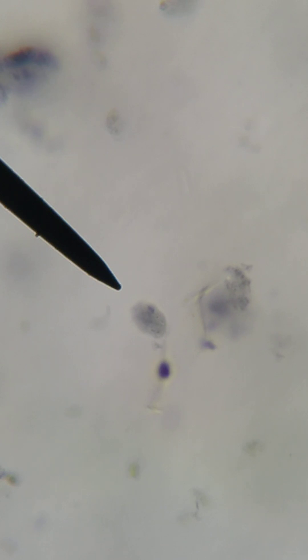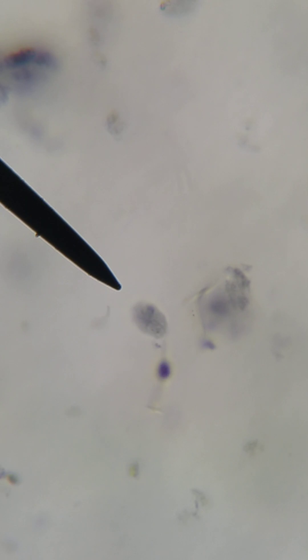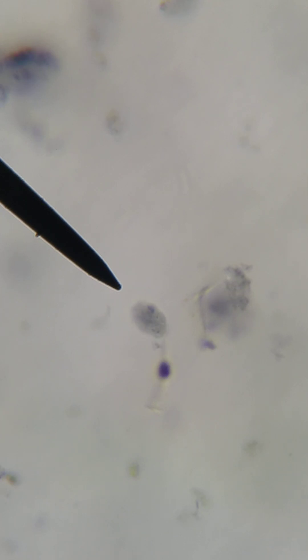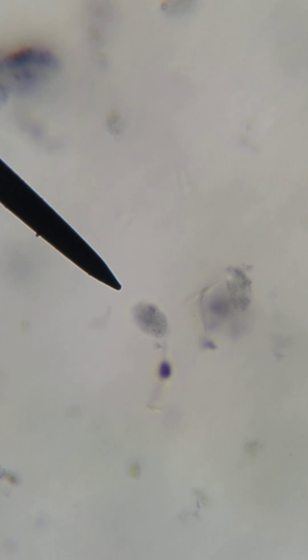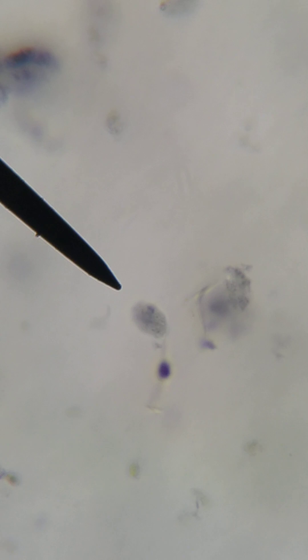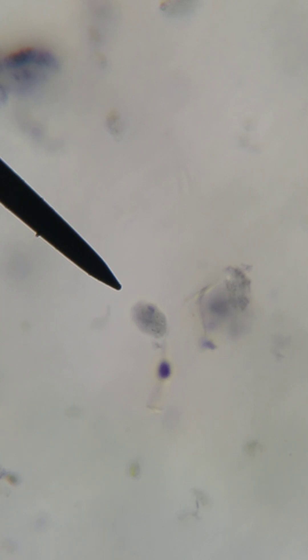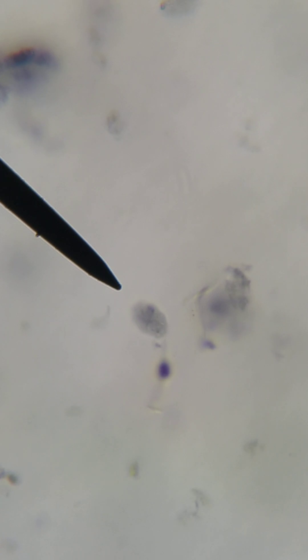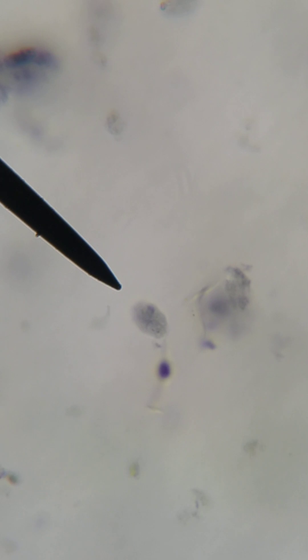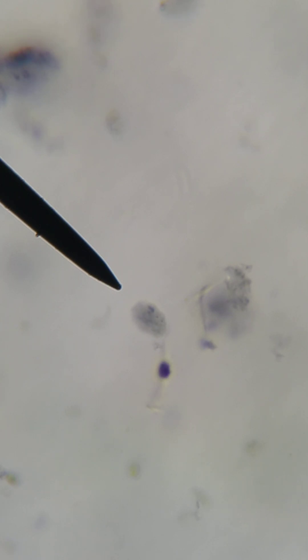Hello everyone, and today we are talking about Giardia duodenalis. Right now in front of you I have a trichrome stain smear of a fecal specimen from a person with a Giardia infection. This is caused by a fecal-oral route, meaning that the person has swallowed this cyst from contaminated food or water that was contaminated with fecal material containing this organism.